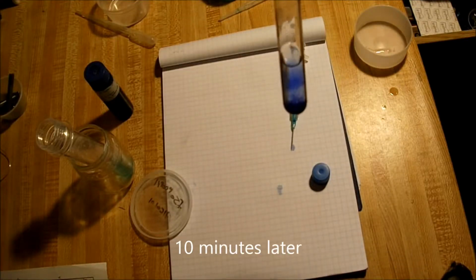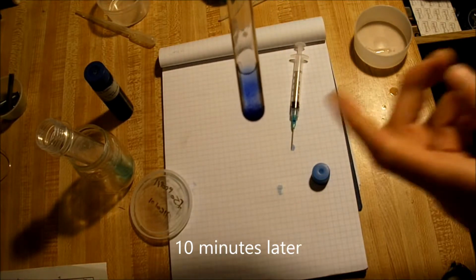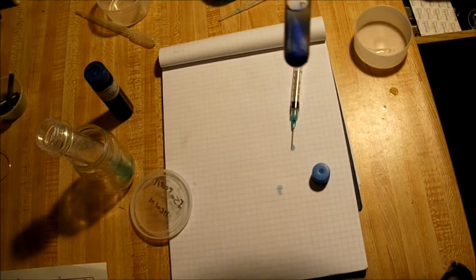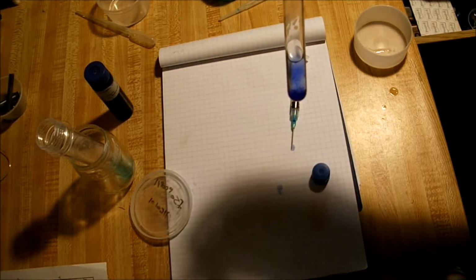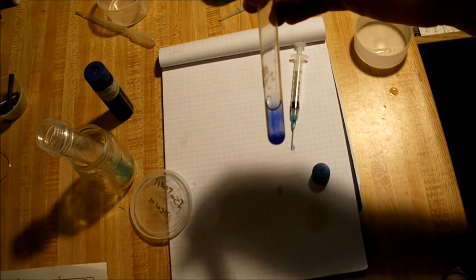Let's check in again on our first experiment, the precipitation of TACS, and as you can see, most of the crystals have formed at the bottom. Now, all you have to do to obtain the solid crystals is to separate the alcohol from the precipitate with a filter, which can be as simple as a coffee filter or as complex as a lab filter.